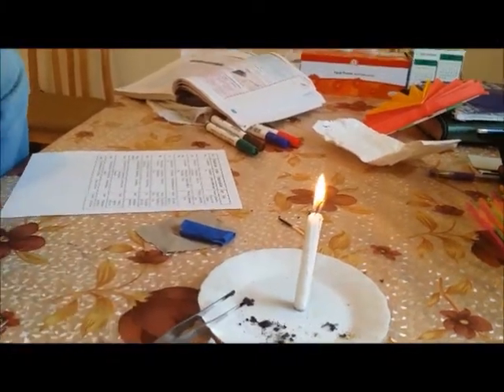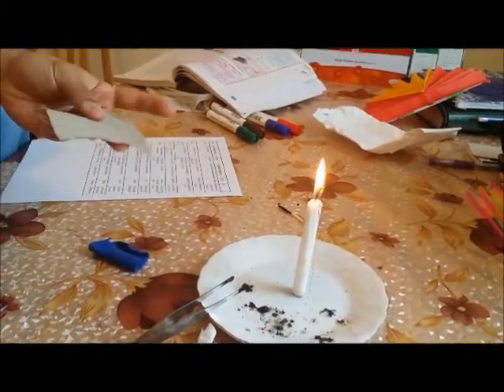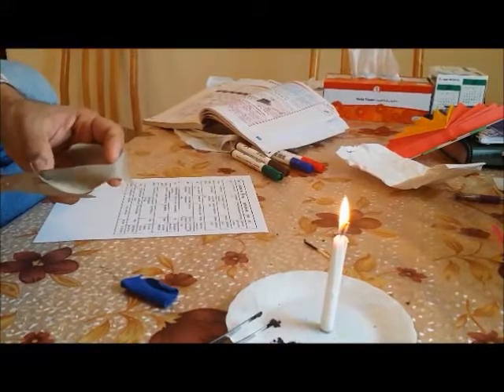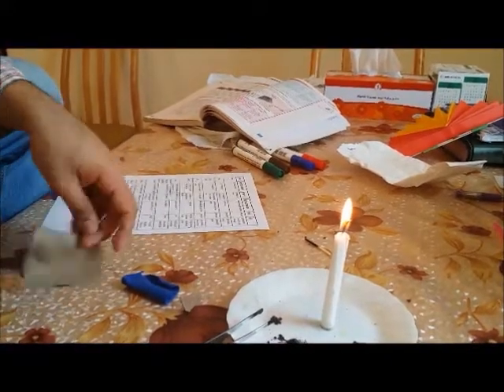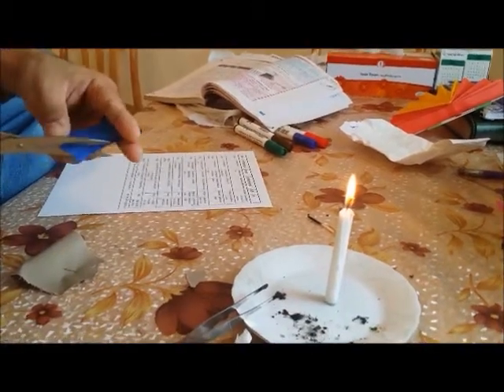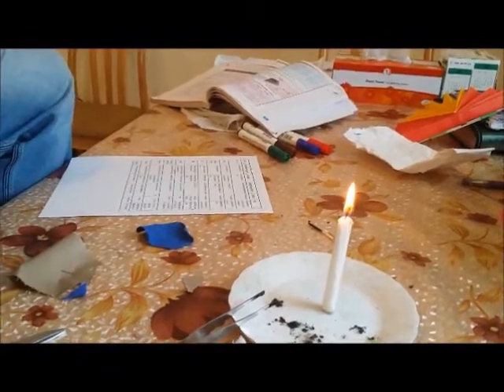These are the different samples that I tried to do here. Here are two more samples which I don't know about, so let me try using this test — and then I will give it as a test to my students so that they can do the practical themselves. So let's come back to the related question part and discuss the different types.